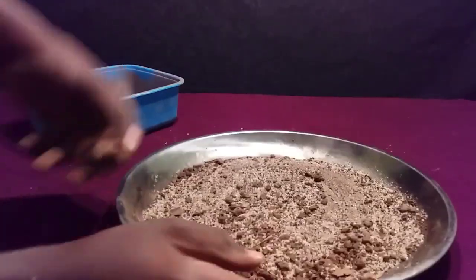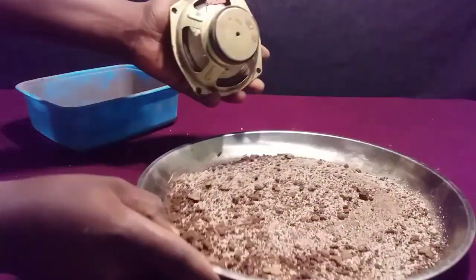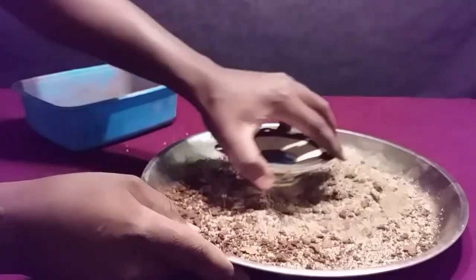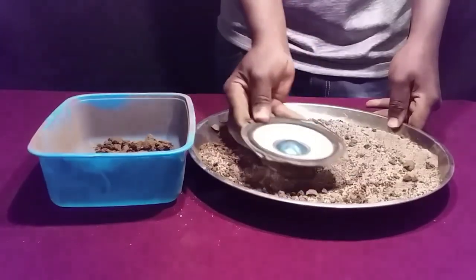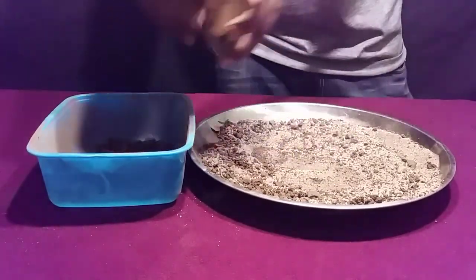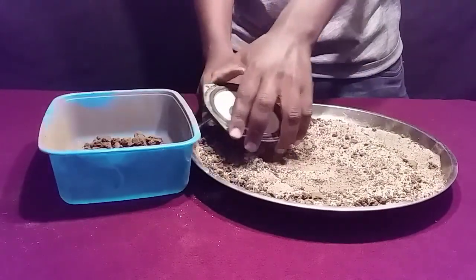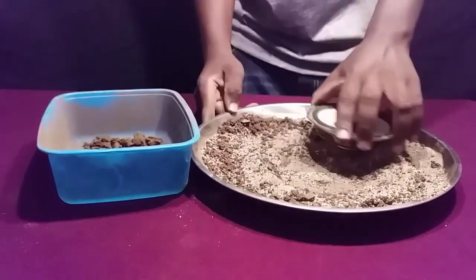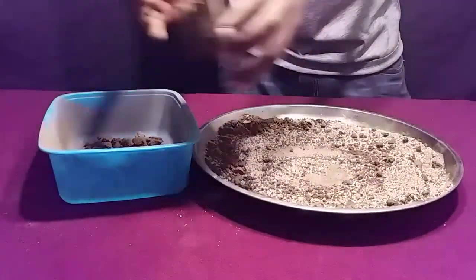I'm going to use a piece of magnet to try to remove the sand. Before rushing into dissolving your mixture in water, I find that it's a good idea to pick up as many sand particles as possible, because this will help to simplify the filtration process at a later stage.